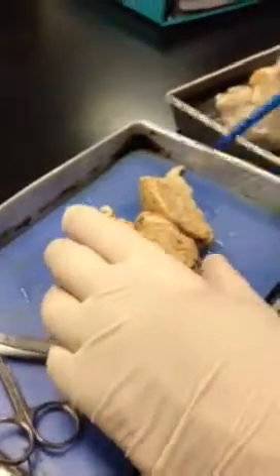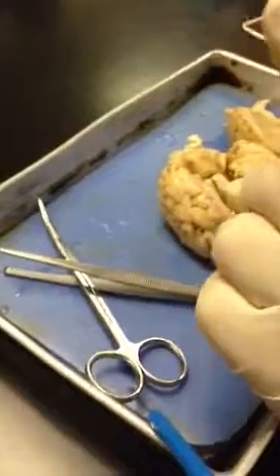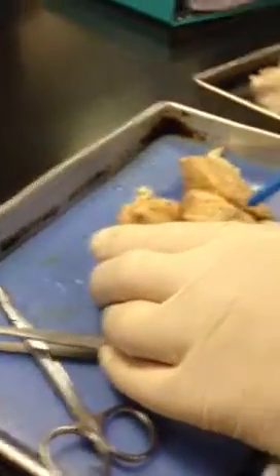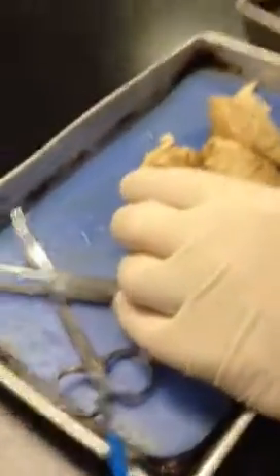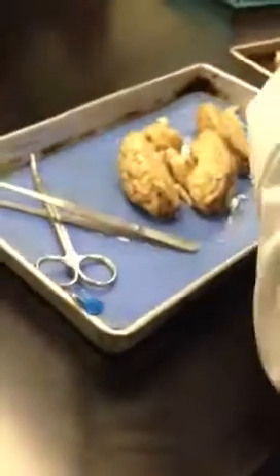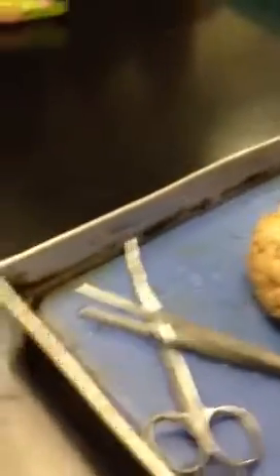So, oh, the third ventricle. The third ventricle is the one that's kind of hard to describe to you guys. So this is the thalamus, and I'm not sure where we pulled it away. And this is the thalamus over there. But if we pull these two things together, so here, let's do it this way. My right hand is one thalamus, and my left hand is the other thalamus, and we put the brain together, and it looks like this.